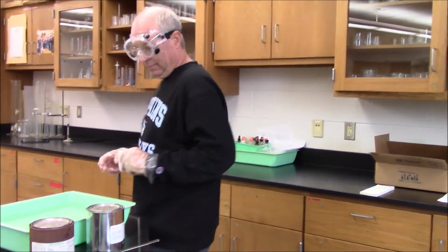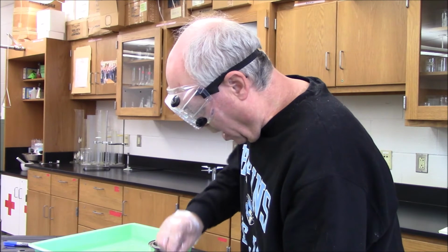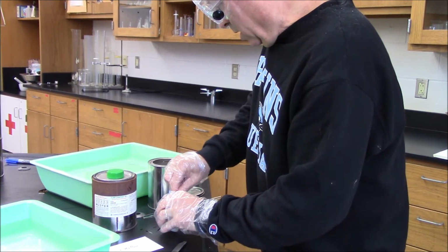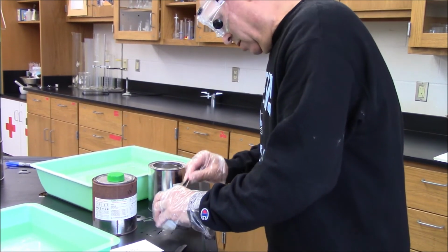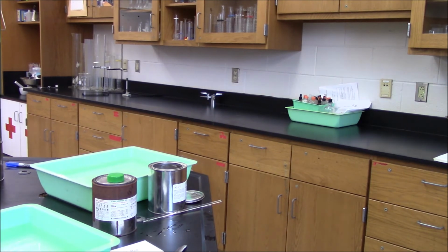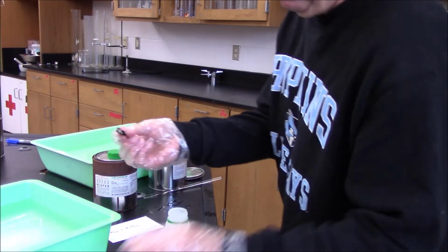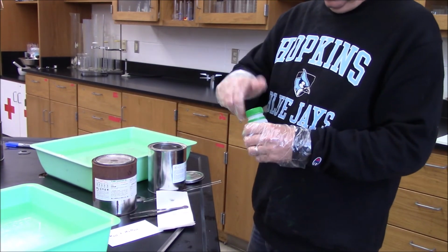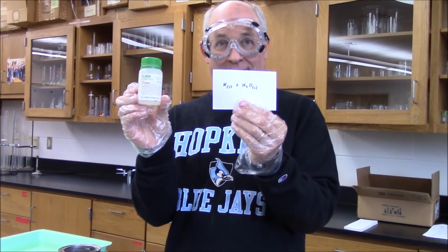Last one coming up. Not good tweezers. It's so slippery, of course. Get another pair. Okay, we going? Yeah.